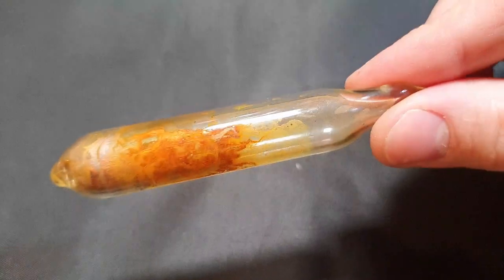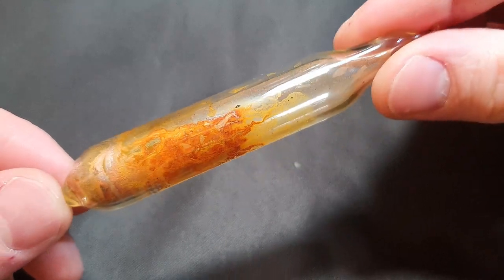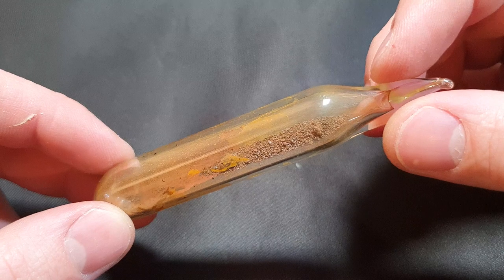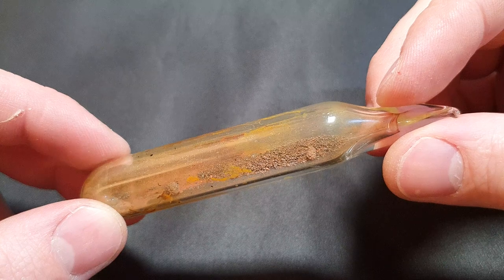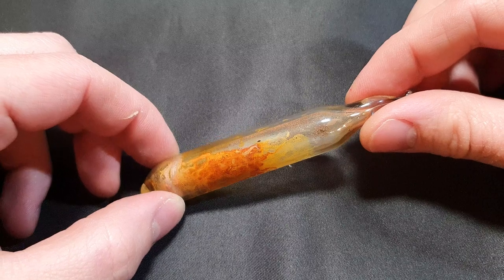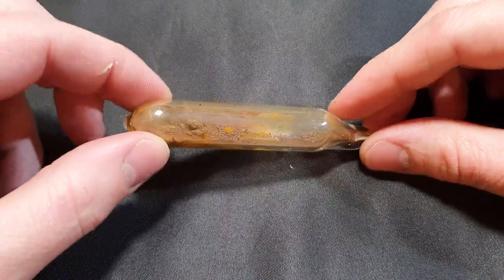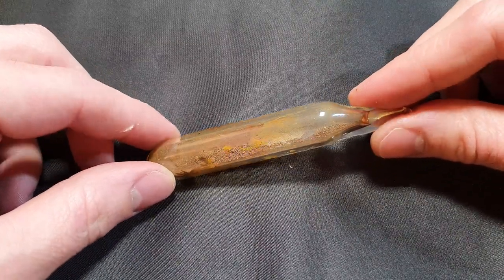This is the final product. The product on the walls looks as expected — a yellow-orange substance — but the solid in the vial has a reddish-gray appearance, almost like rust. I don't really have an explanation for that. Maybe it's some form of polymorphism. I don't think it's the oxide because none of the cesium in my still oxidized. Or maybe it's a mixture of unreacted gold and cesium auride. I will try to recrystallize it with liquid ammonia in the future to see what happens. If anybody has an explanation for the appearance, please write a comment.